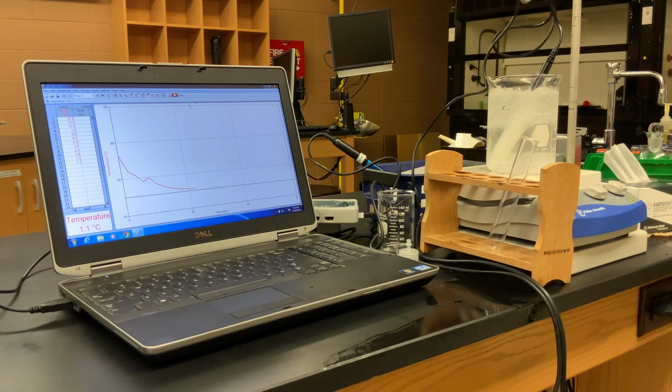Okay, we're at 1.1. So again, our temperature differences are getting smaller and smaller. The last couple of readings, we had 2.2, then we went down to 1.6. That's a 0.6 degree difference. Then 1.6 to 1.3. That's a 0.3 degree difference. And then 1.3 to 1.1, that's a 0.2 degrees Celsius difference. So we're seeing our curve start to flatten out.